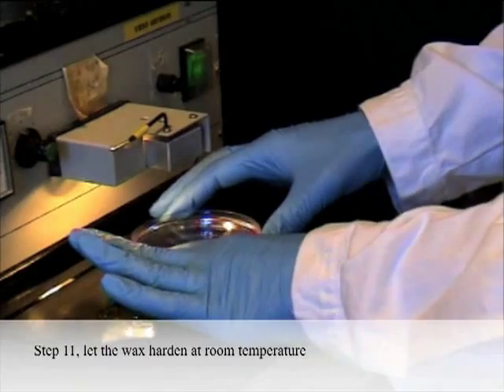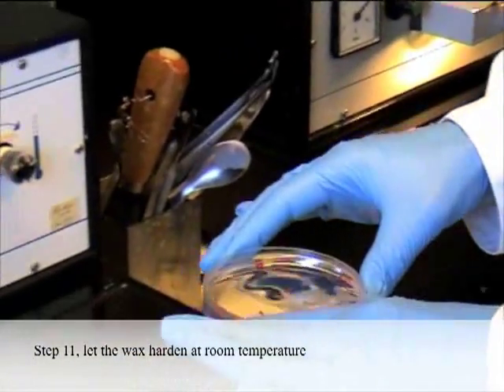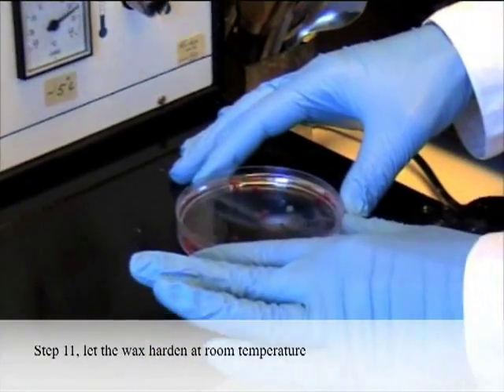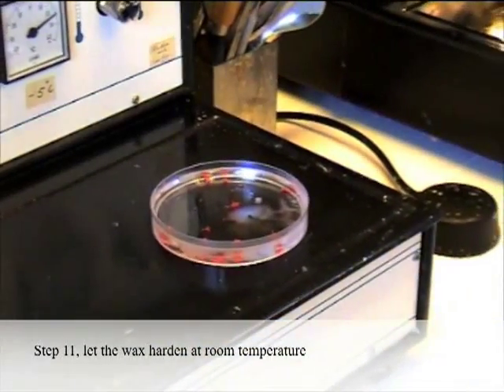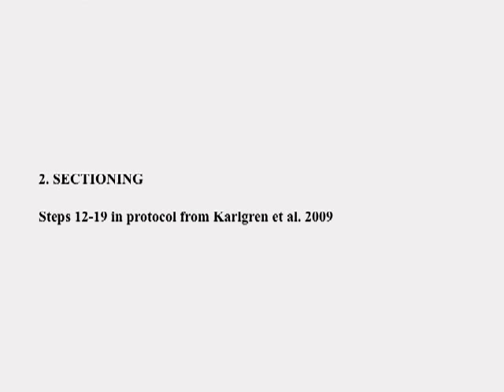Step 11: Let the wax harden at room temperature. 2. Sectioning. Steps 12 to 19 in the protocol.